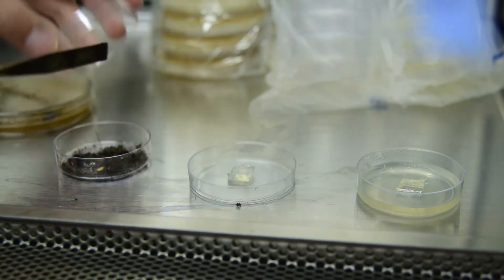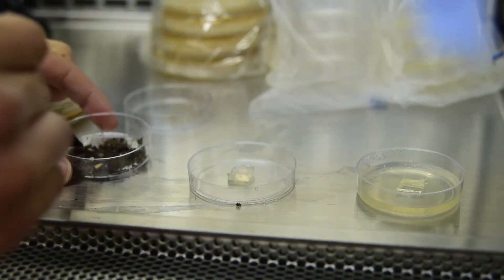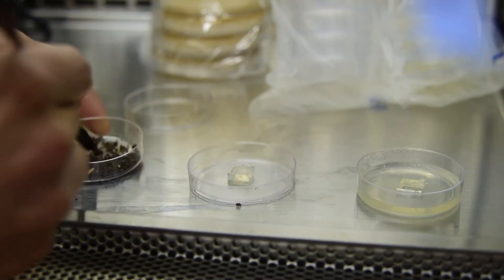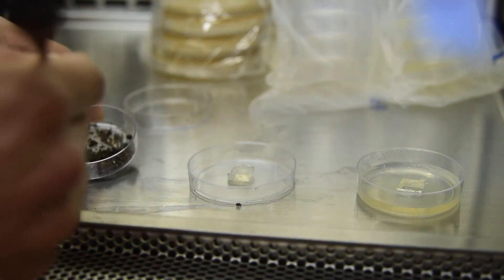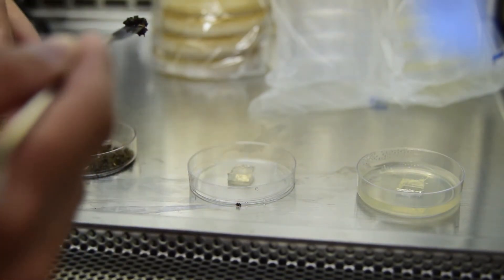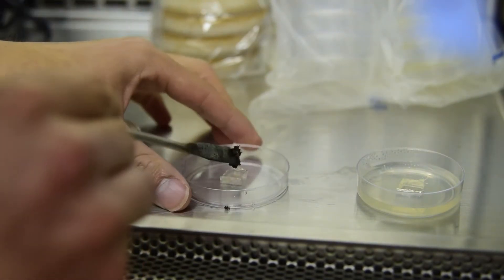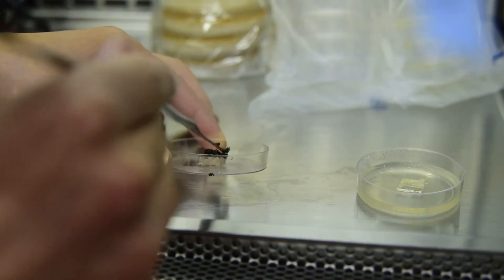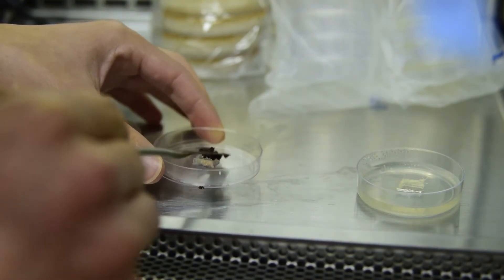Take some sterilized soil, you may have to mix a little bit, then place on the small square. It needs to be low and flat enough to not touch the top part when inverted.